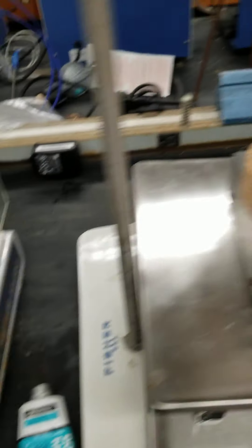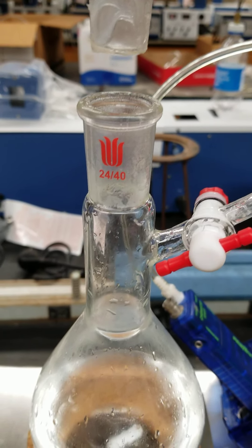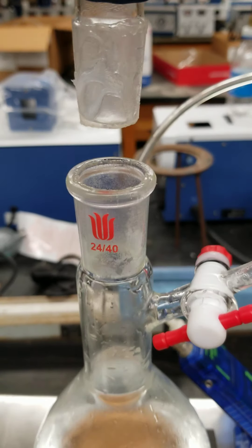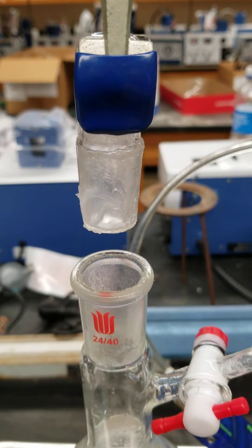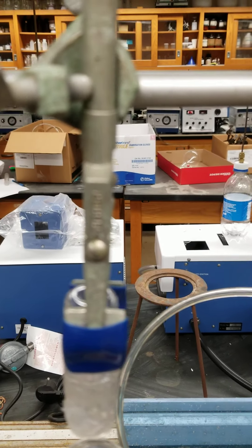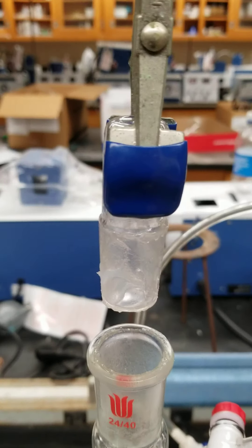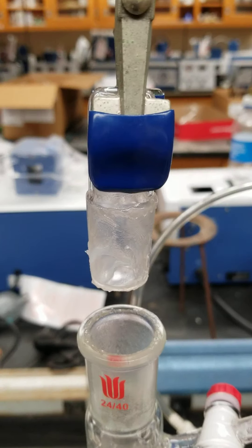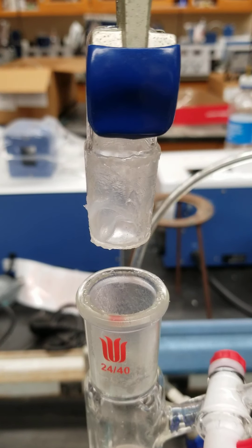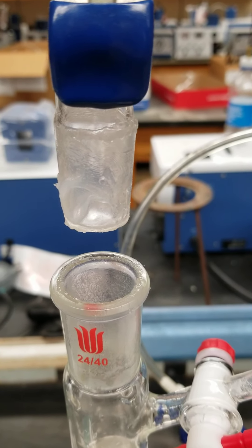So what's the protocol? I will drop a known mass of carbon dioxide into the flask, then close the vent and raise this very quickly to the top. The system is set such that it can't push up because of the rod going perpendicular up there. We'll seal it, let it come to equilibrium, and then at that point I'll turn on the data logger, record the base pressure, turn it on, and then record the equilibrium pressure on top. But since I'm working alone, I might not be able to show all the operations.